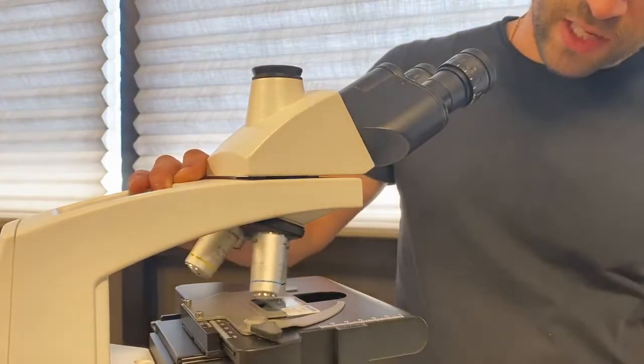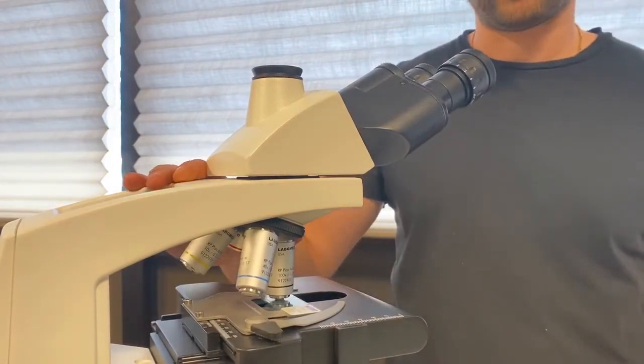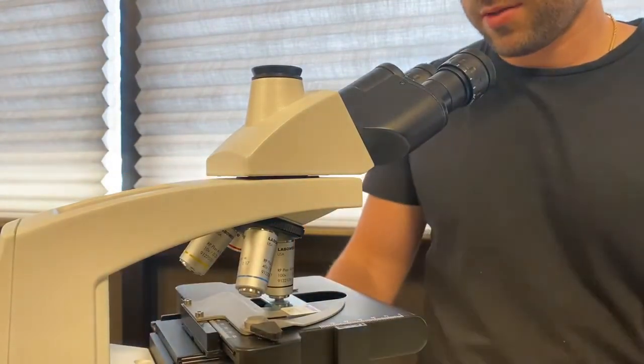Pass the 100x objective through the oil a few times to spread it evenly and focus your microscope.